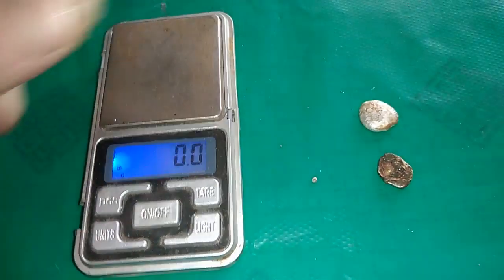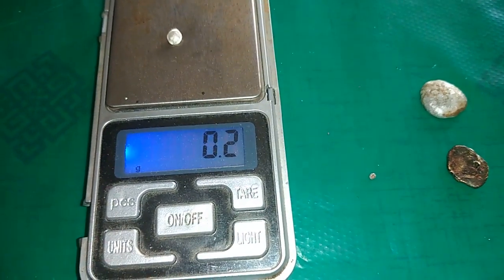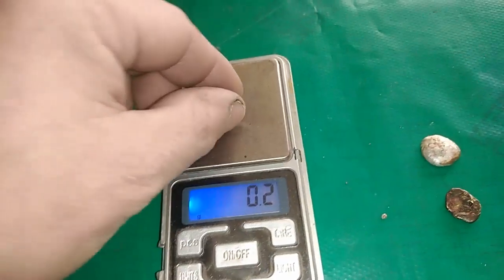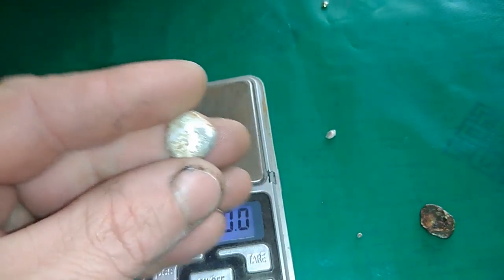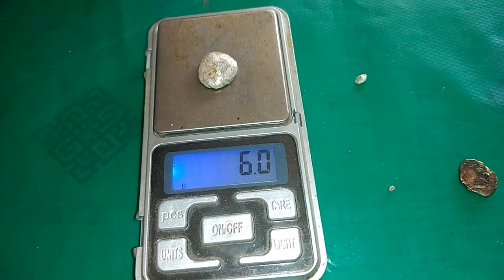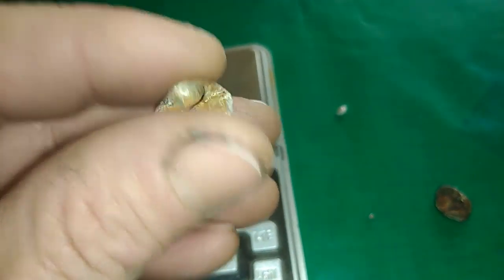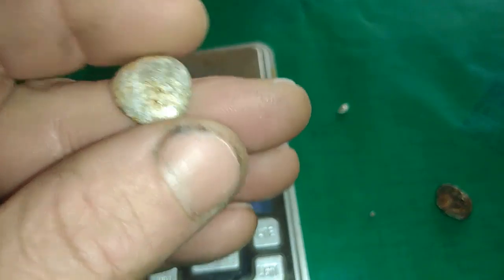From non-magnetic MLCCs — see how much this palladium weighs. 0.2 gram. Well, not bad. 0.2 gram, pure palladium from non-magnetic MLCCs. And from the same MLCCs, a lot more silver — around 6 gram of silver. So I repeat once again: it's very dirty, so I need to clean all that in hot HCL, from that borax and that junk.